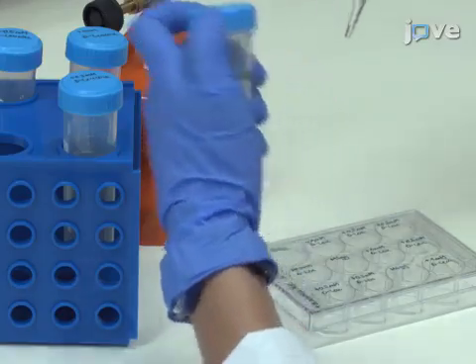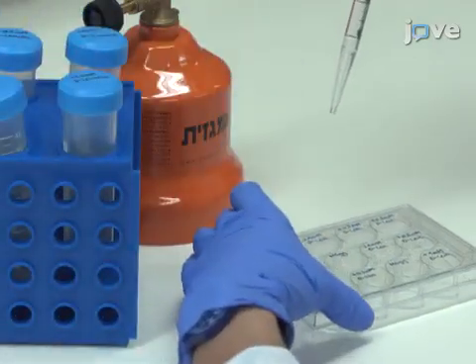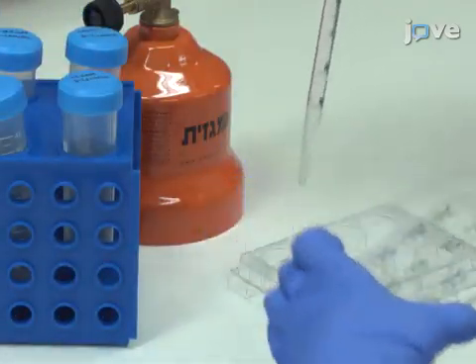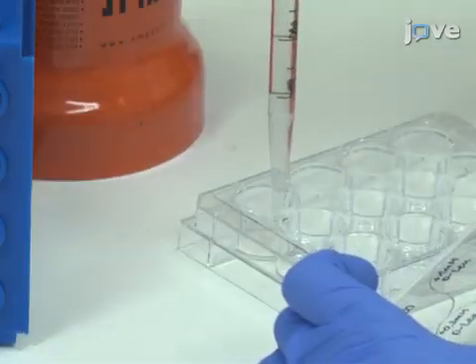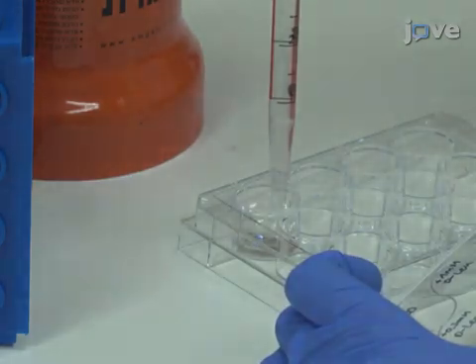To grow pellicles, prepare a 12-well cell culture plate by adding 3 milliliters of MSGG to each well.